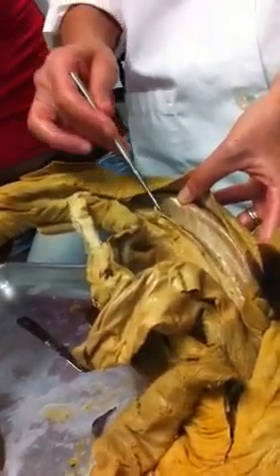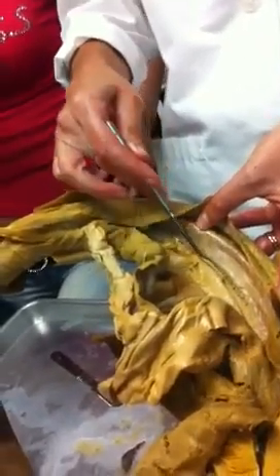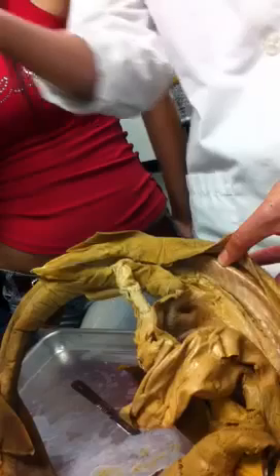You'll find something kind of similar in all the rest of the vertebrates, only most of the vertebrate kidneys look more like lobes, right? Not so much like a long coiled up tube. But you'll always find them in the same spot. You might have to take away a lot of the parietal peritoneum before you can see them because they're enclosed in a separate membrane there on the dorsal surface of the body cavity.